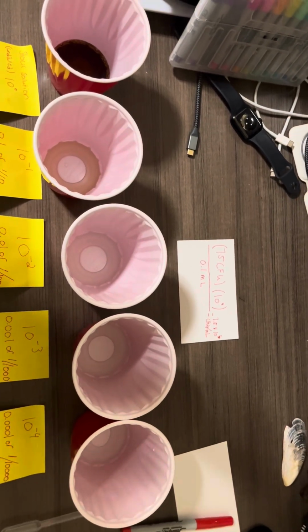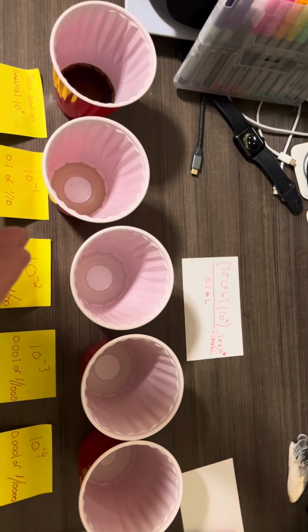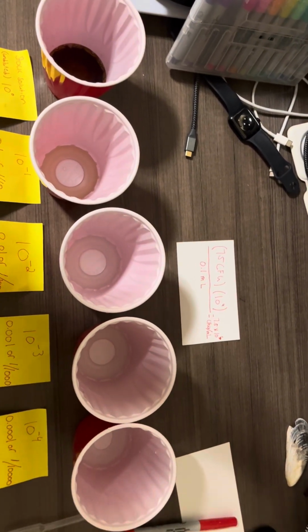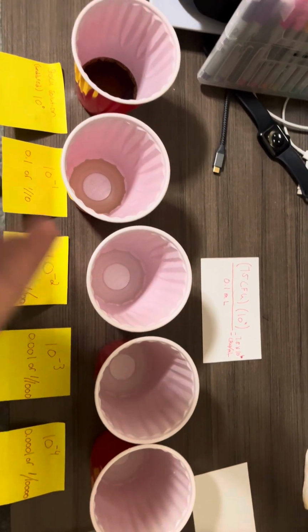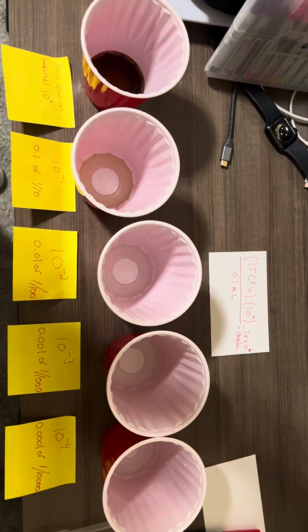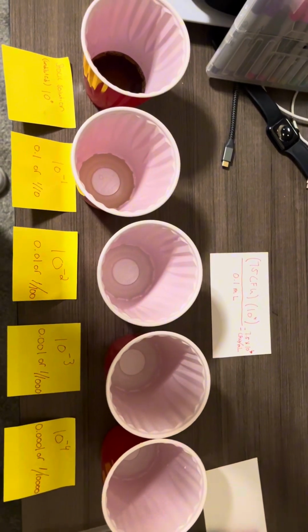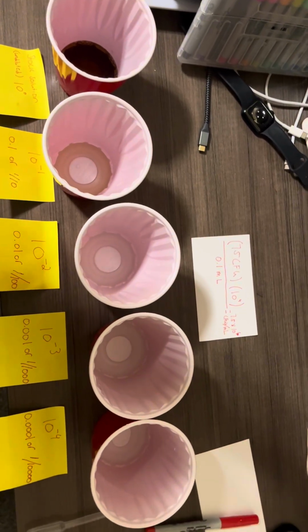And then from there, in order to dispose of all of this nasty liquid, you would in turn pour each of the cups into your liquid disposal. In our case in the lab, it is under our hood. And then you would dispose of each cup and each pipette in your solid waste bins, which we have at our lab stations and in the fume hood as well.